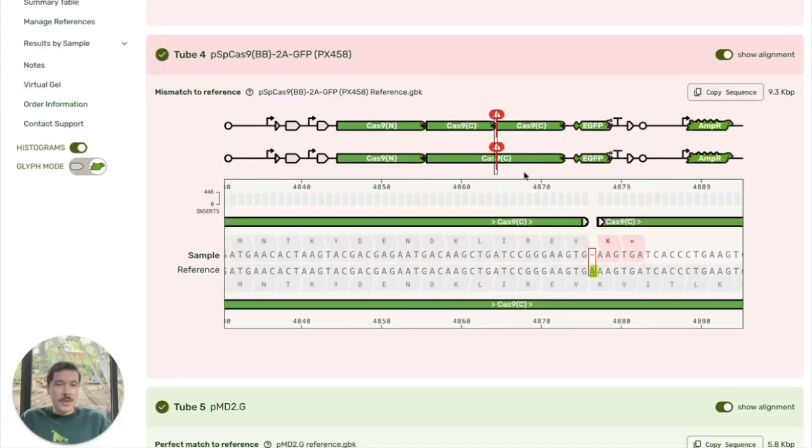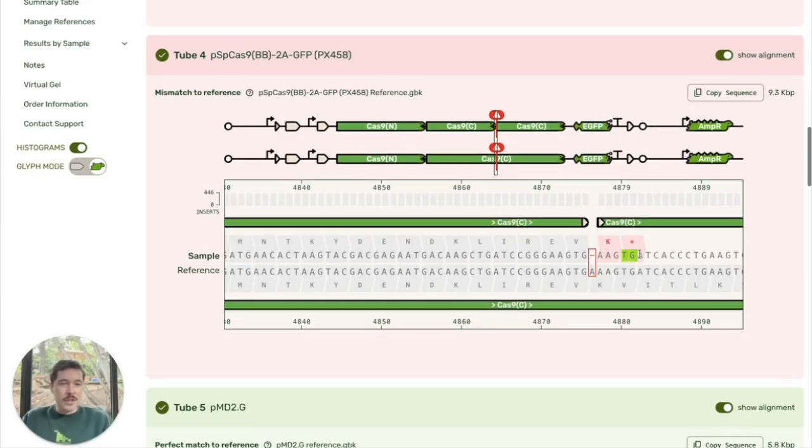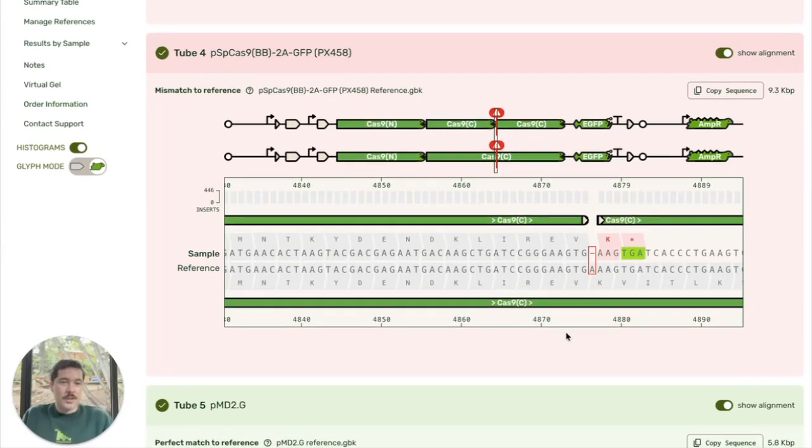And you can see that we have got, as it highlighted, a deletion of one base pair. It's matching before, it's matching afterwards, but we're missing this A. And you can also see that this has caused a frame shift. And so in the reference, you can see that we keep making protein. However, this frame shift has introduced an early stop codon. So we know that in the sample that you sent, this protein is going to be truncated.